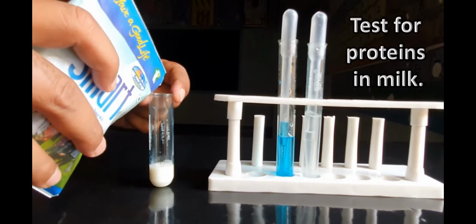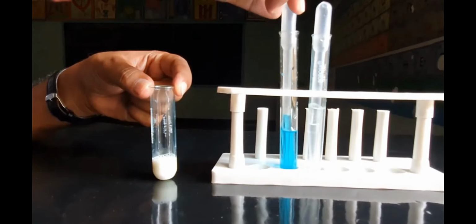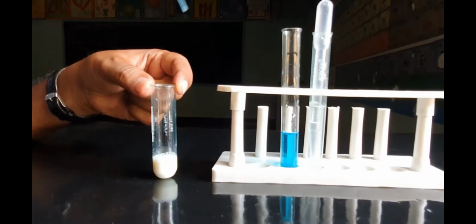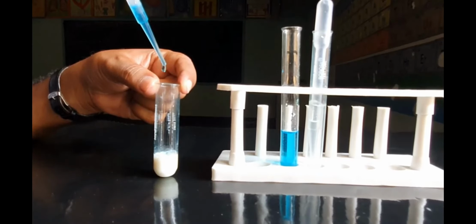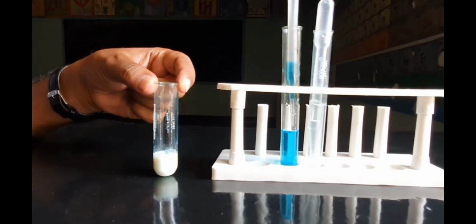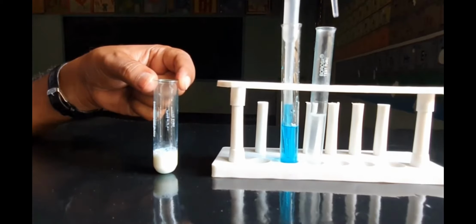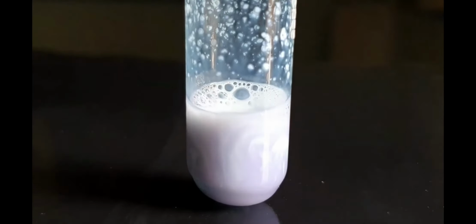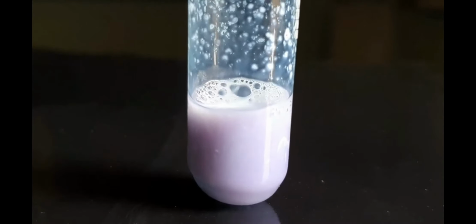Similarly, we will test for protein in the milk. We add a small amount of milk in the test tube and then add copper sulfate solution and then sodium hydroxide solution, drop by drop. You can see that the milk is also turning into purple color, so it indicates the presence of protein in the milk.